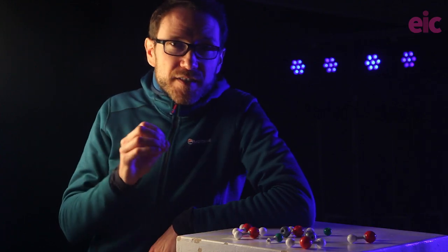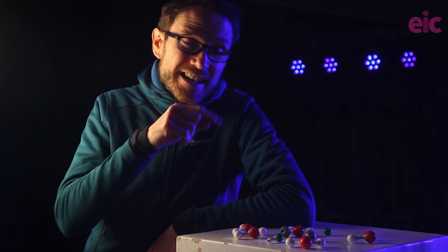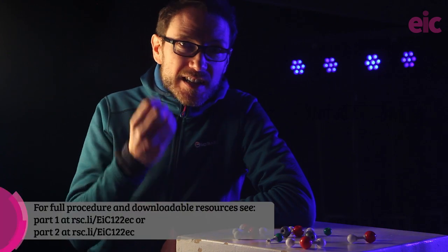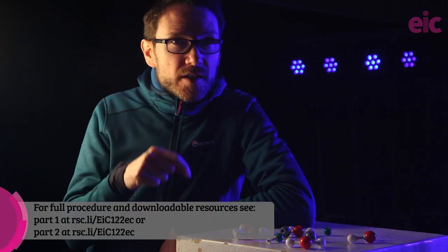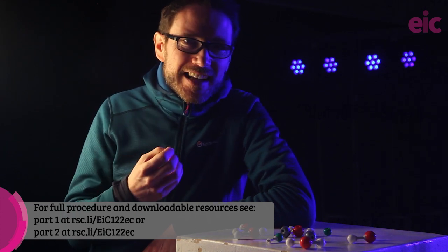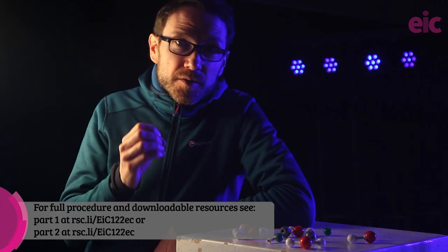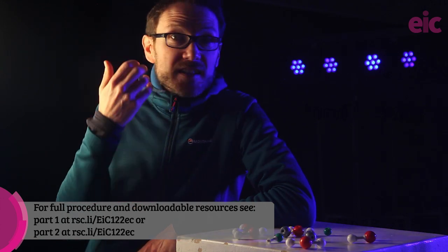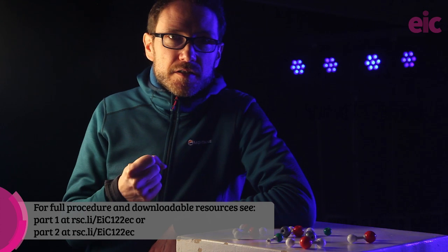Now, if you're coming to this video without having seen part 1 in last month's column, you really need to go there first. I explain in detail why I've chosen the concentrations that I have, and much of that won't be repeated in detail here. I'm going to assume that you're up to speed with the basic setup, the choice of equipment, and the logic of the dilutions that I've used.